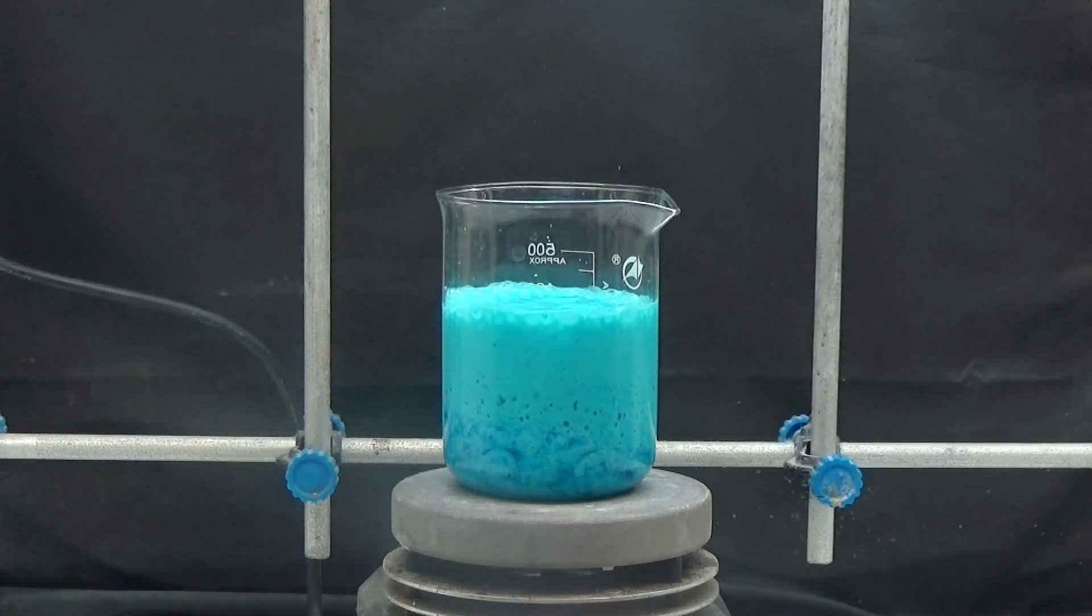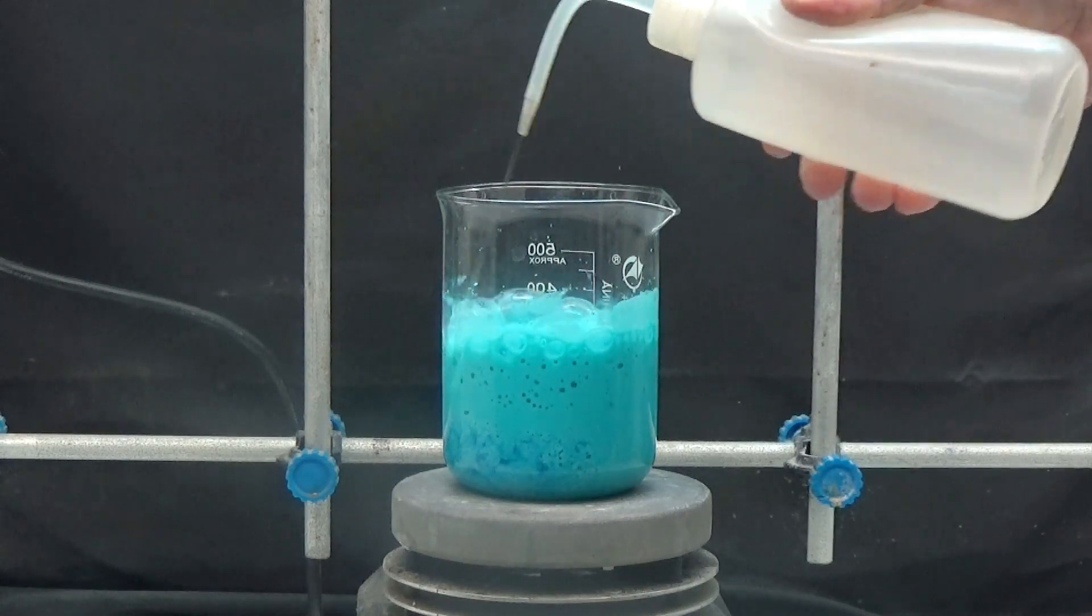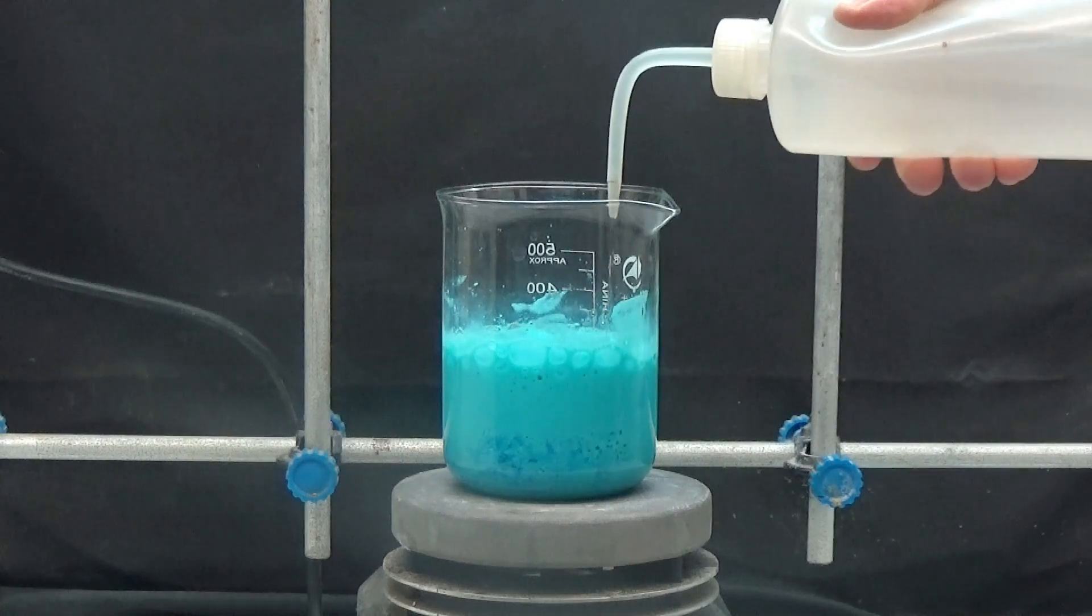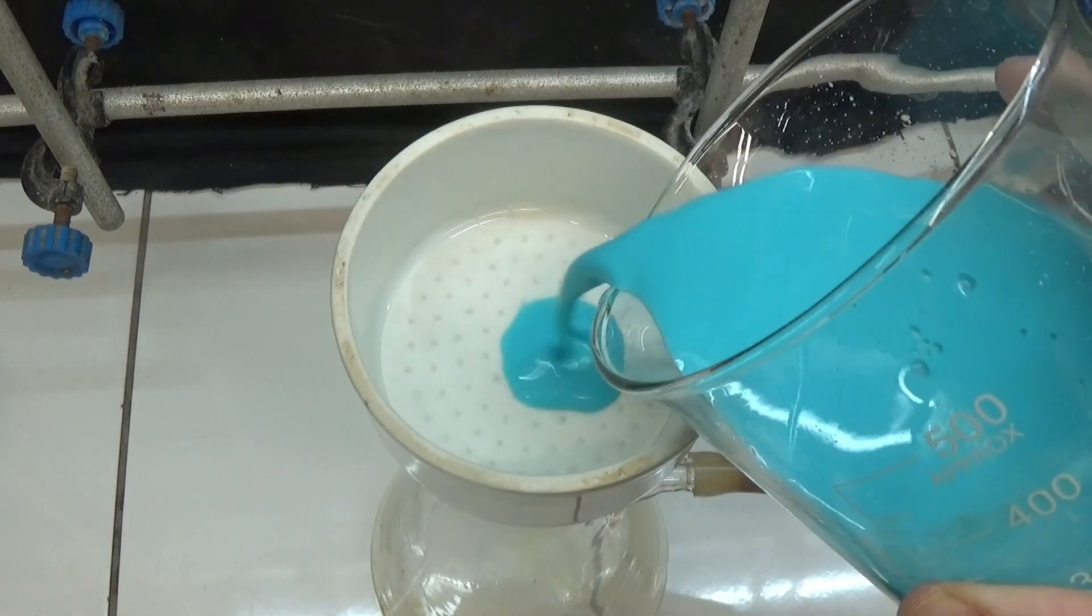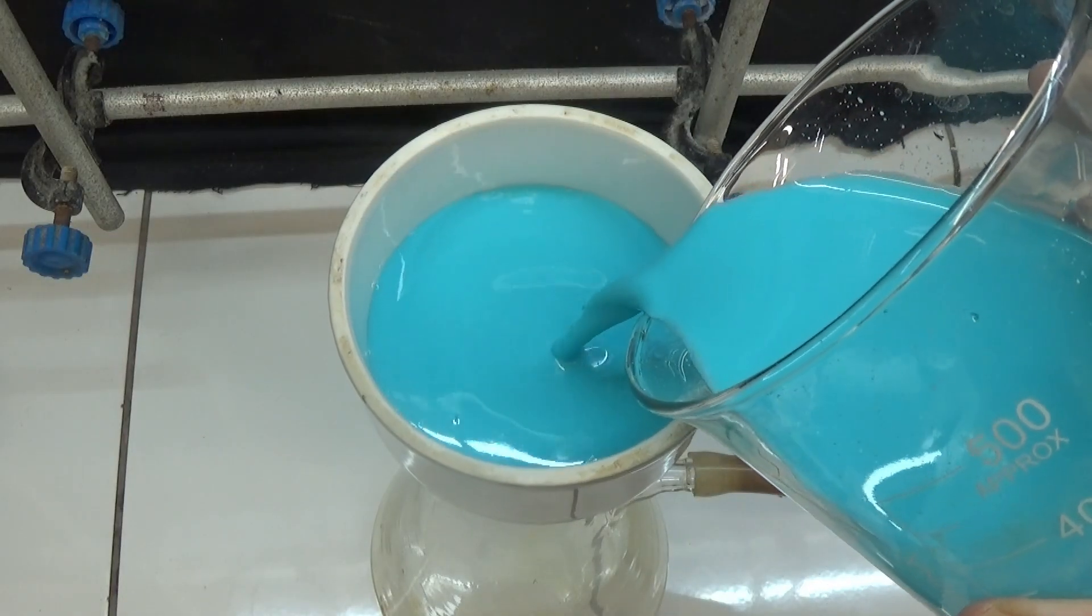Leave in agitation a few minutes, adding a little water if necessary. Collect the carbonate precipitate by suction on a Buchner funnel with filter paper.